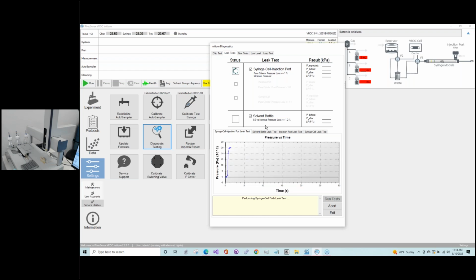In terms of troubleshooting, if you do have any sort of failures, we'll talk about the injection port in a minute. It could be the O-ring, which we'll talk about when we change the consumables, or once we get to the other tab on our Initium diagnostics, there's a way to reseat this injection port cover to make sure everything's okay. And in terms of the failure of solvent bottles, you want to make sure everything is tightened, particularly if you just recently filled up your bottles, or if you've had your caps for an extended period of time, beyond a year, you may need to consider replacing those. Over time, as Marina said, they do age and they will unscrew themselves and cause leakage.